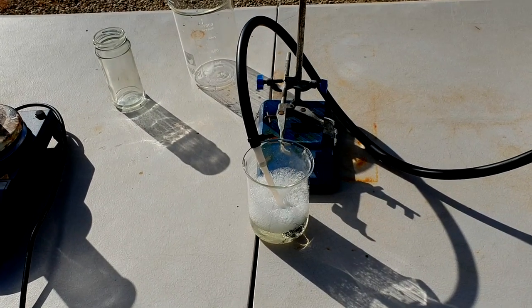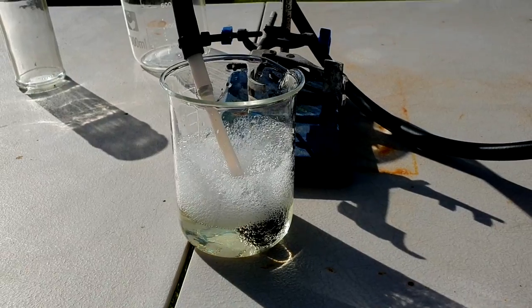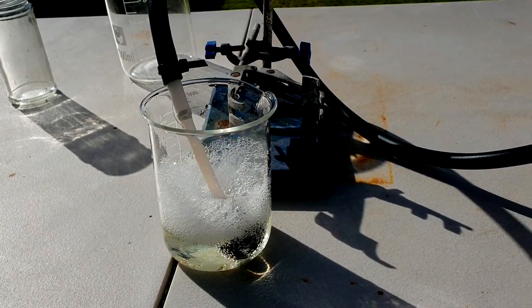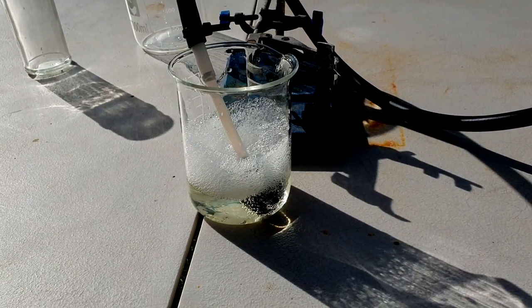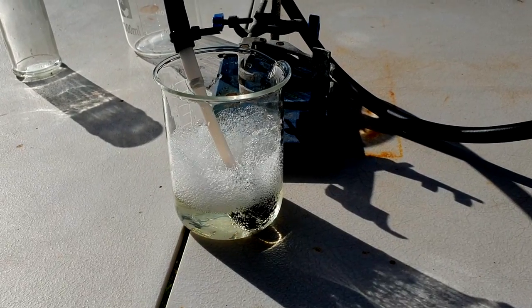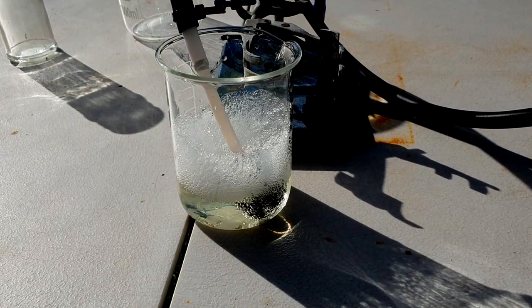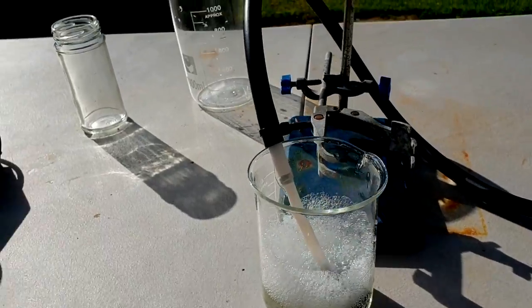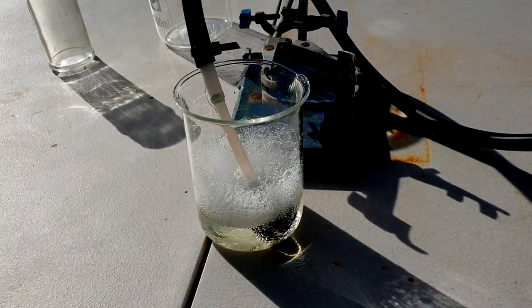All right, I've swapped out that jar for a beaker here. It allows that foam to build up a lot and us to crank the flow rate up to maximum. So, you can see a lot of gas is being trapped there in the bubbles for a very long time, which I think is just as good as having a very long path length. I could be wrong.